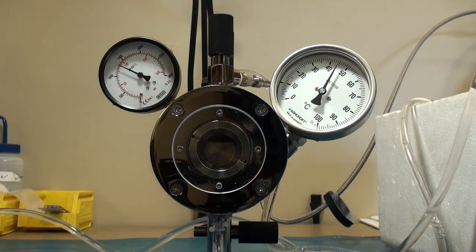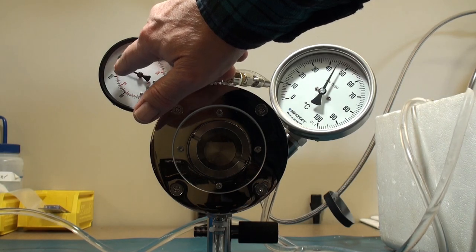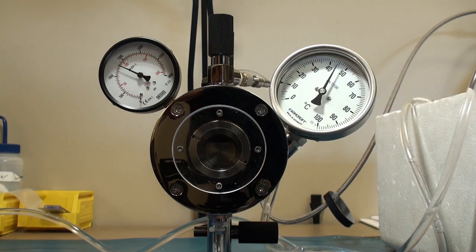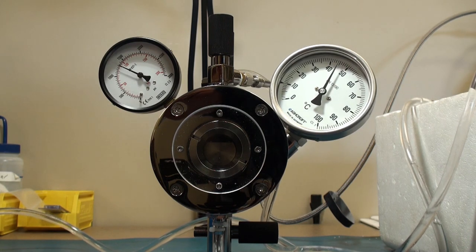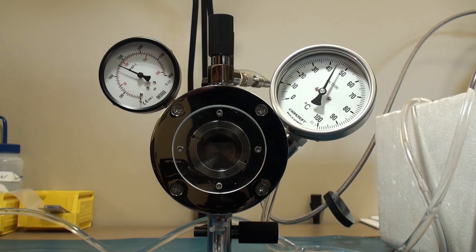And here we are, we're still slowly bleeding off the pressure. We're down to 1300 PSI and about 45 degrees Celsius. And again, if for whatever requires for biological material which has been processed and dehydrated and such, you shouldn't have to maintain any longer than ten or fifteen minutes above the critical pressure and temperature.